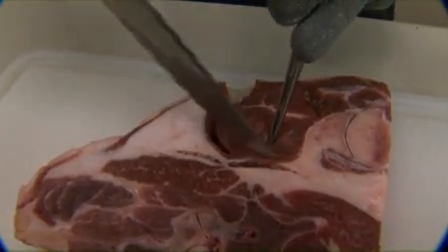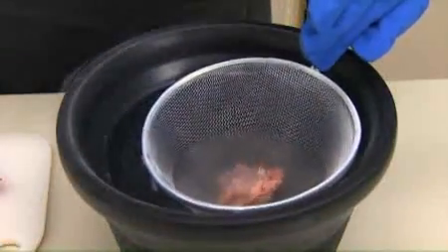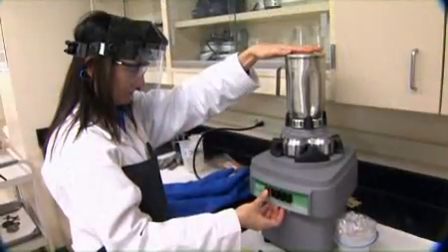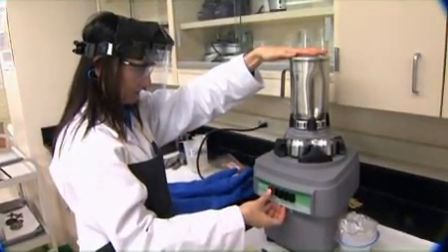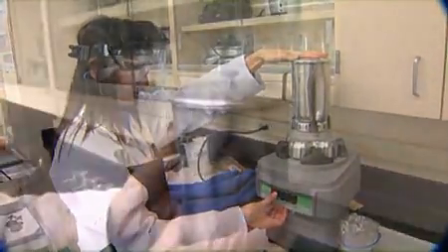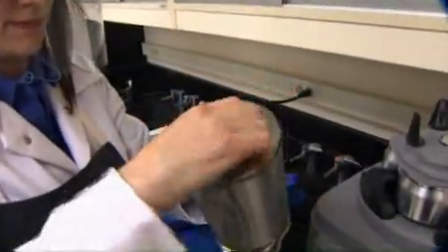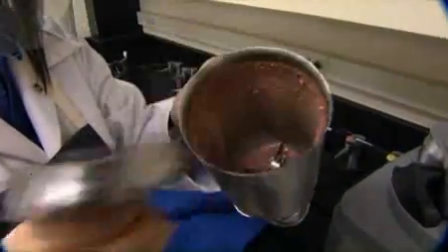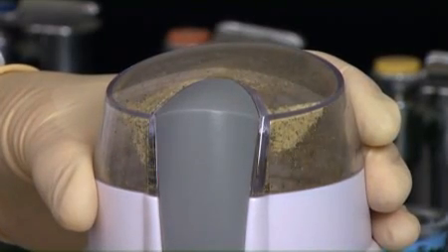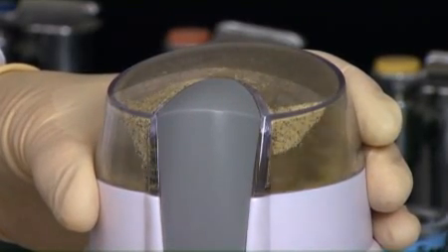It is important to note that before a sample is analyzed, it must be properly prepared so that an accurate test result can be obtained. This is achieved by homogenizing the sample. Homogenization ensures that all of the sample material will be of consistent content throughout and suitable for analysis. For details, please refer to Preparation of Test Samples, Analytical Services Method Number 1.